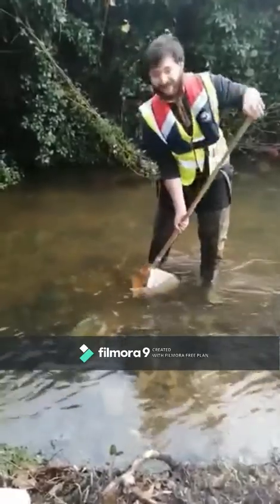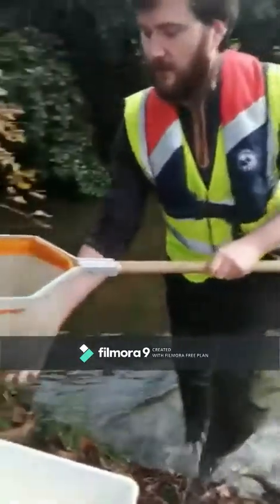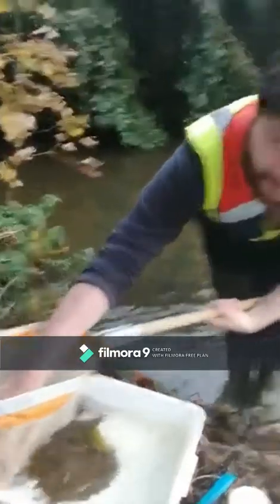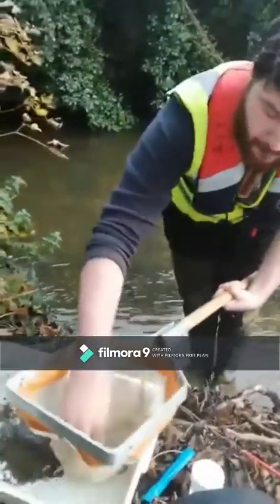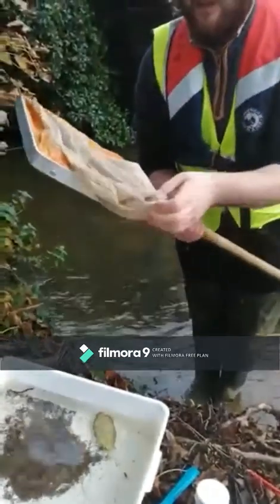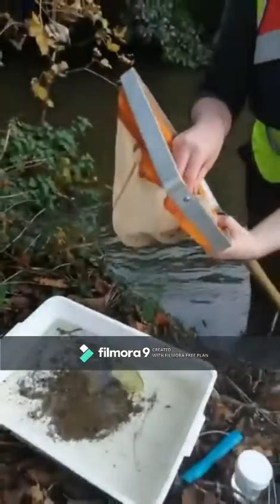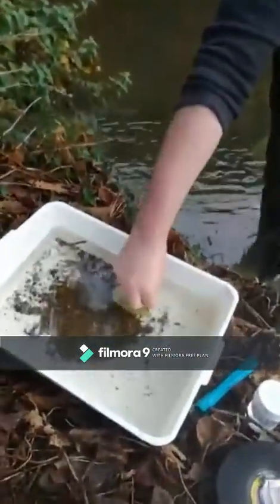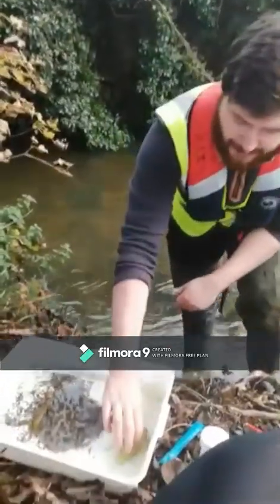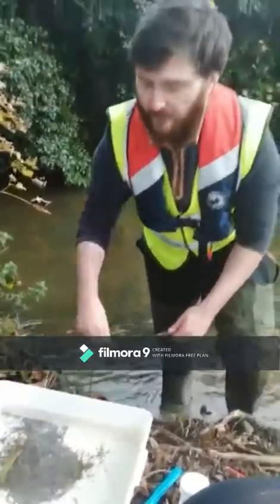Now that all the species are collected in the net, we transfer what is found into our tray for collection. Ensure that the net is clean before putting it back in, because some species can collect onto the net, as you can see here. Next, ensure that any debris, such as leaves, are taken out, and inspect it to ensure that nothing is clinging onto them.